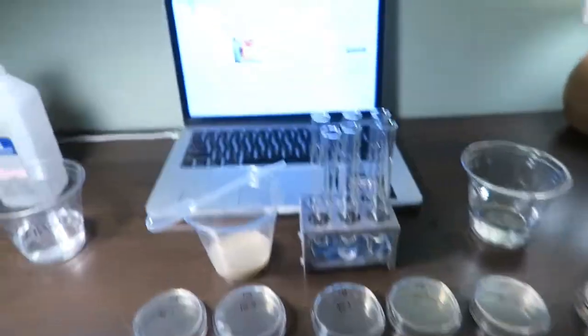Hello, my name is Michael Batista. It is March 15, 2019, and this is week two. This is my lab exercise: bacterial enumerations, dilutions, and plate counts. This is part one of my video demonstration, and here is my setup.